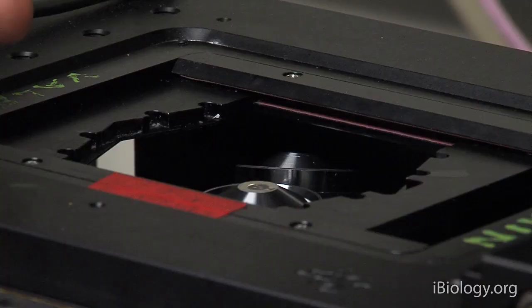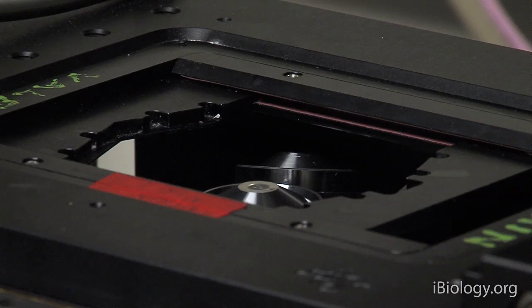Next, we have to make sure we know what objective we're using, whether it's an air objective, a water objective, or an oil immersion objective. In this case, we have an oil immersion objective.